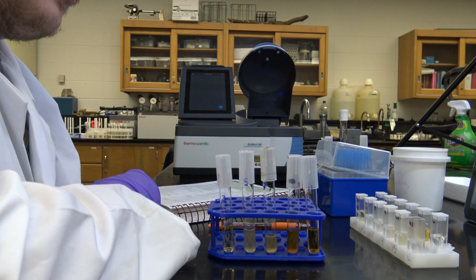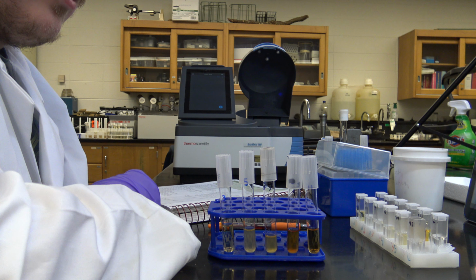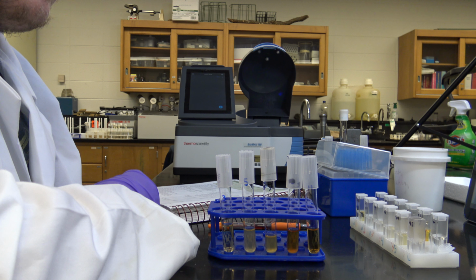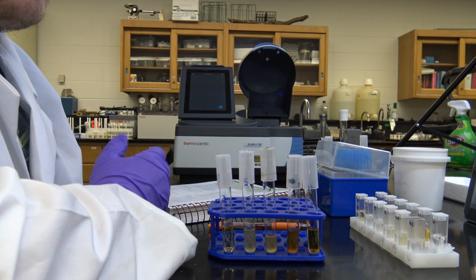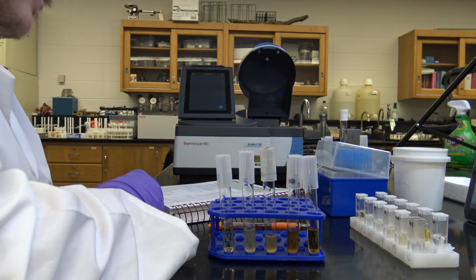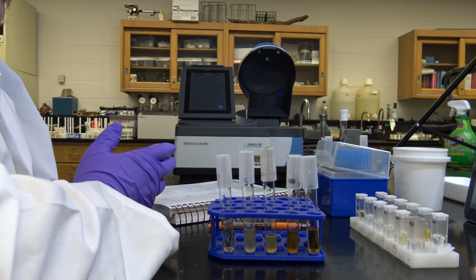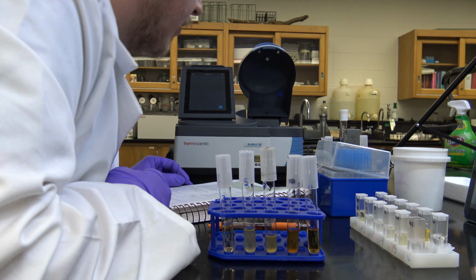I know it has something to do with the fact that the different nutrients in nutrient broth aren't really picked up at 600 nanometers, so you don't have to worry about whether the broth is older or more concentrated. And you can use water as a blank, which is really nice. Anyway, we're going to run the spectrometer.